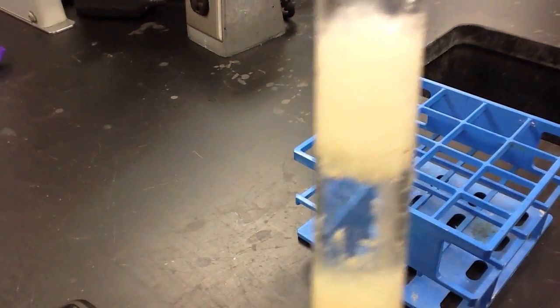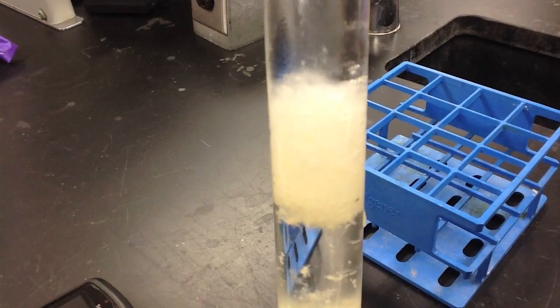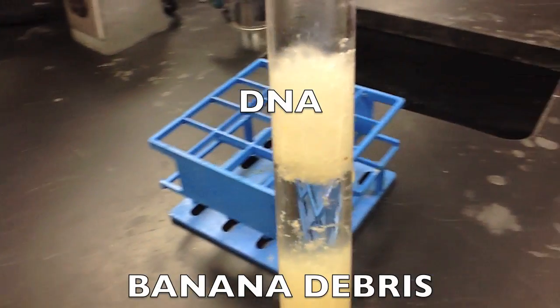Here we can now see a very distinct region of the tube that's filled with the DNA compared to the banana debris.